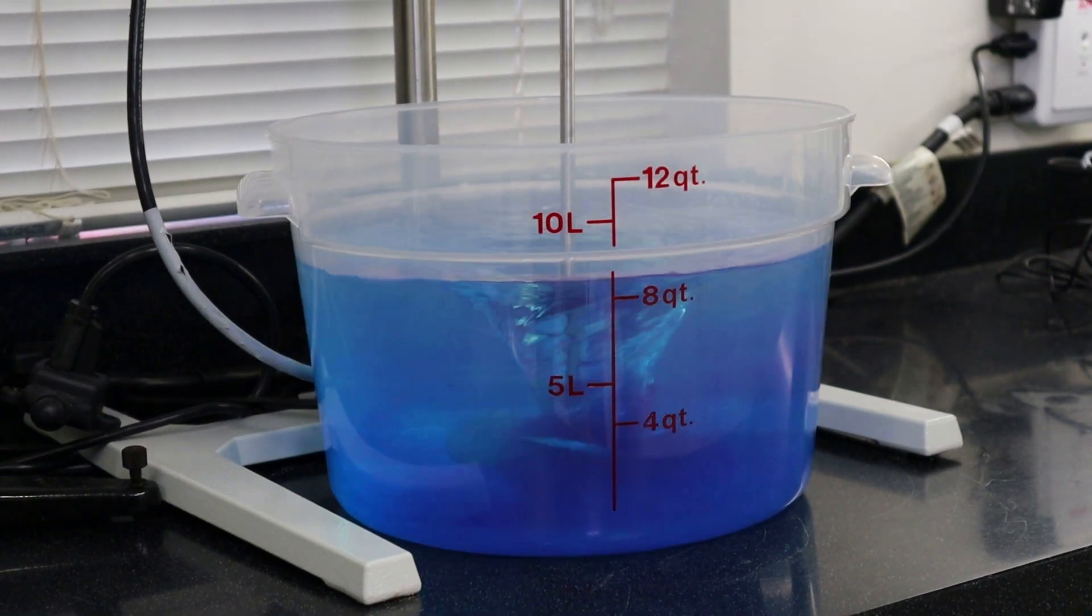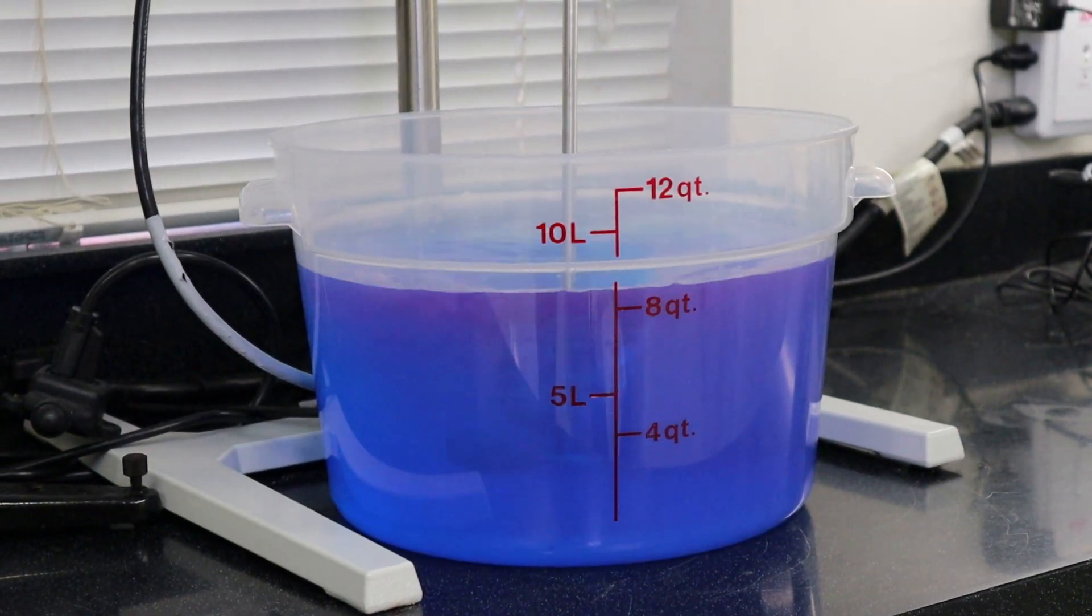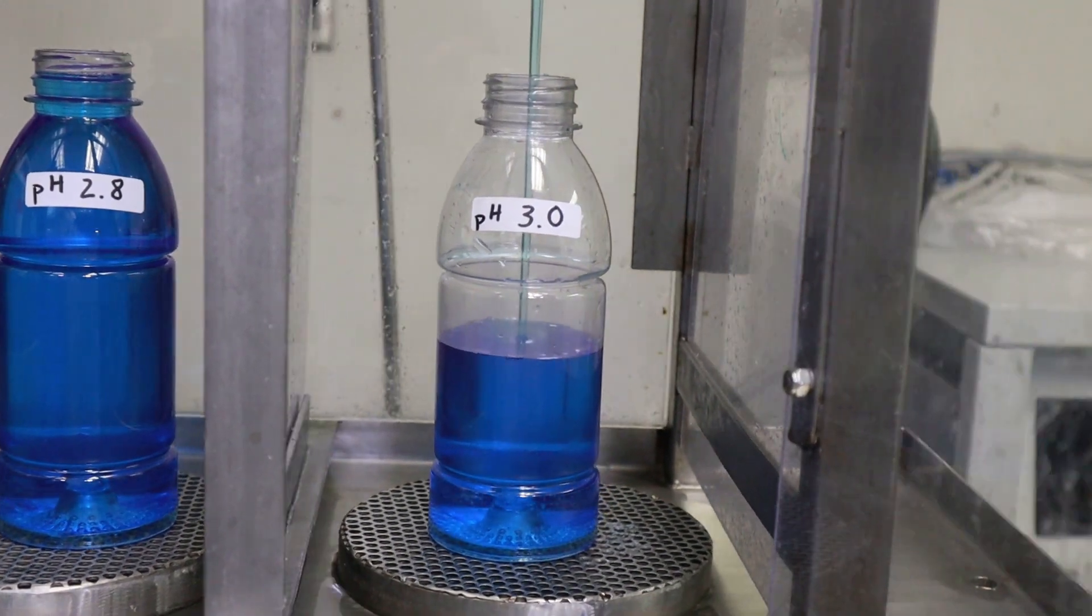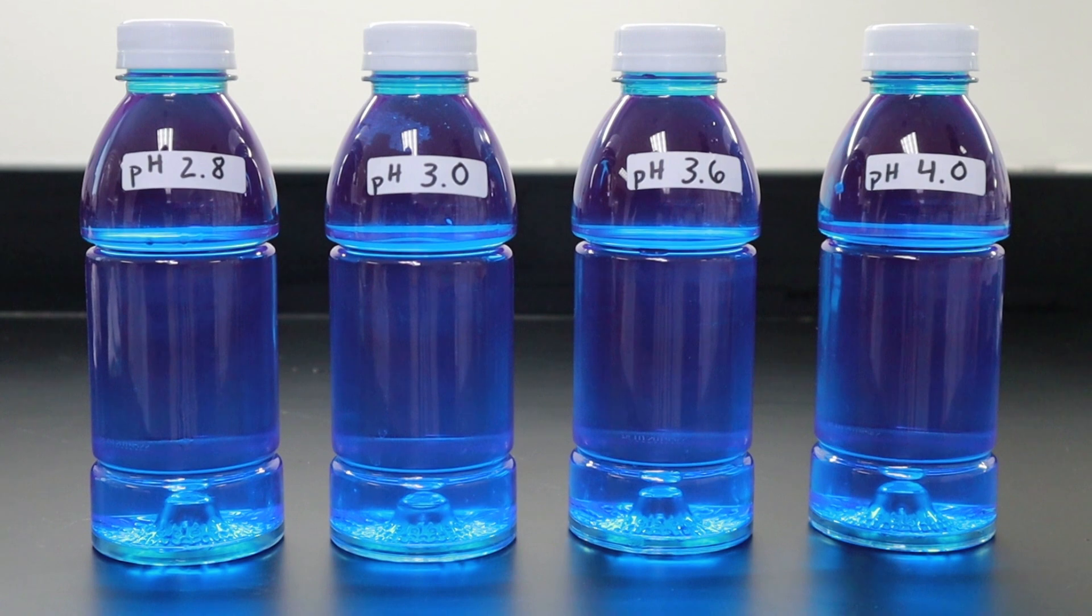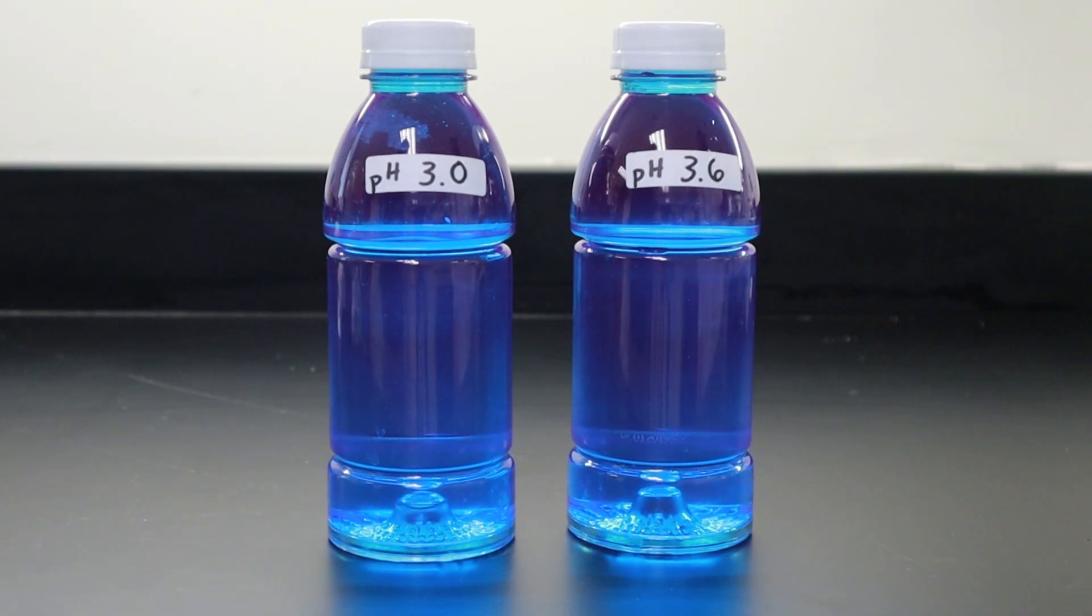We start by preparing multiple beverage samples at different pH levels. The beverages here are pH 2.8, 3.0, 3.6, and 4.0.